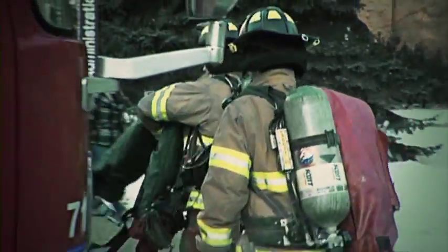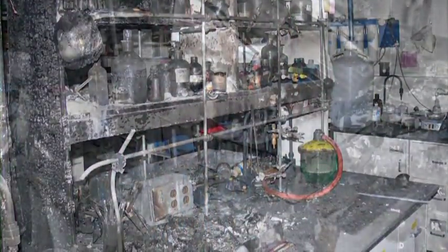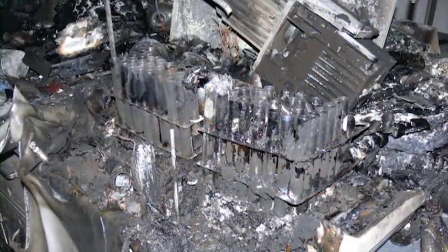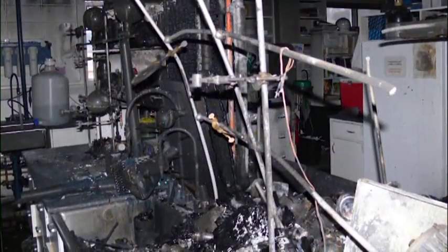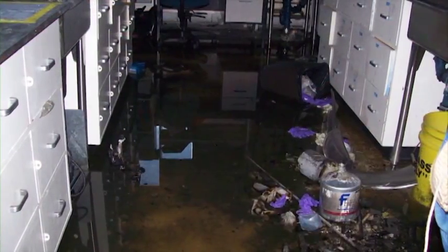After receiving the 911 call, emergency crews arrived to find the lab completely engulfed in flames. Despite some harrowing moments, firefighters put out the fire, but damage to the lab was extensive. Fortunately, no one was hurt, but the insurance claim was in excess of $300,000, and research groups lost valuable time waiting for the lab to be restored.